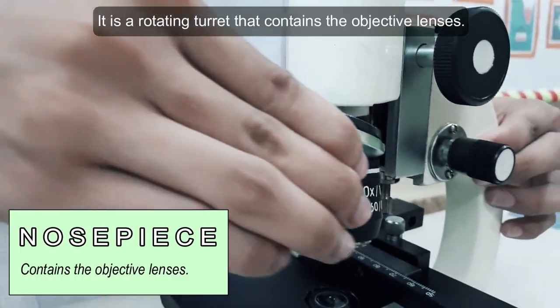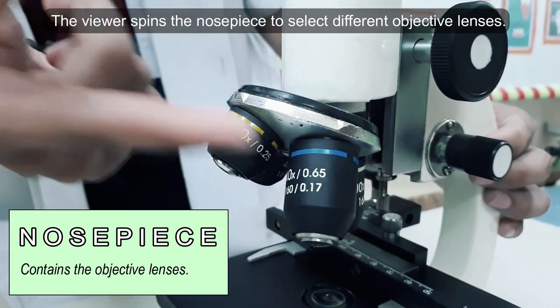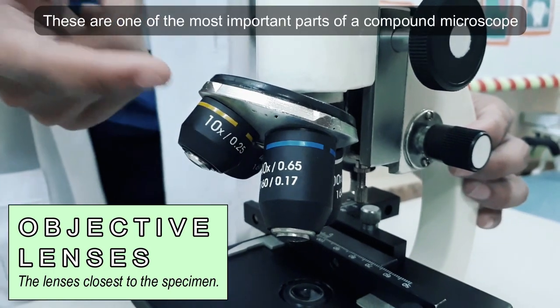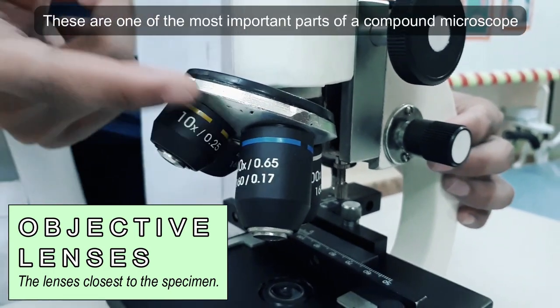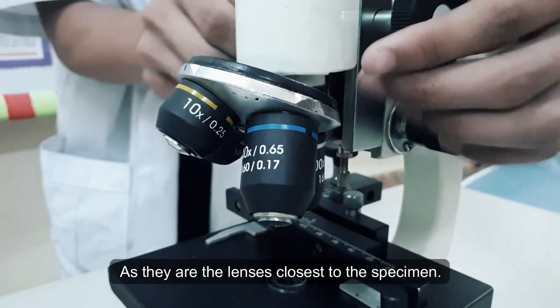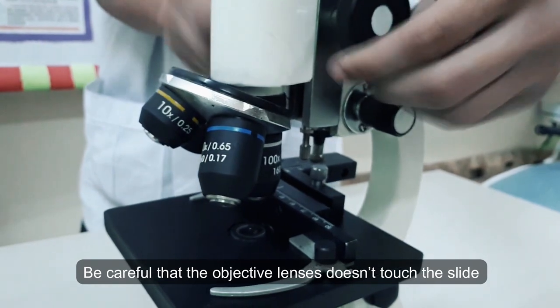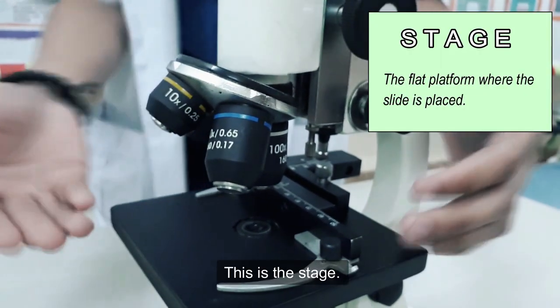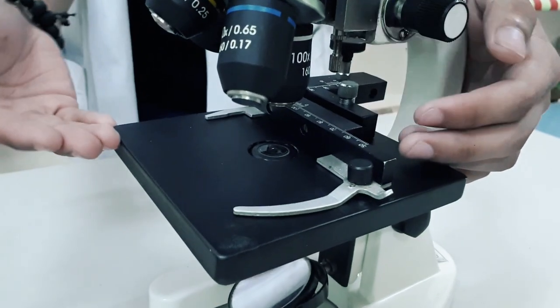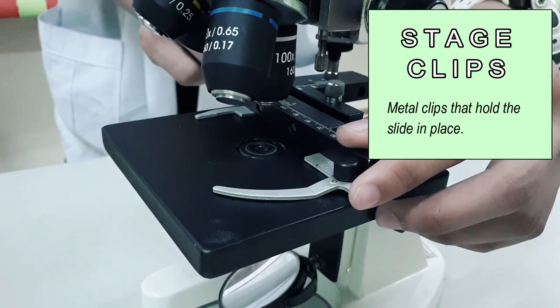The nosepiece — it is a rotating turret that contains the objective lenses. The viewer spins the nosepiece to select different objective lenses. Objective lenses — these are one of the most important parts of a compound microscope, as they are the lenses closest to the specimen. When focusing the microscope, be careful that the objective lenses don't touch the slide. This is the stage — it is a flat platform where the slide is placed. Stage clips are metal clips that hold the slide in place.